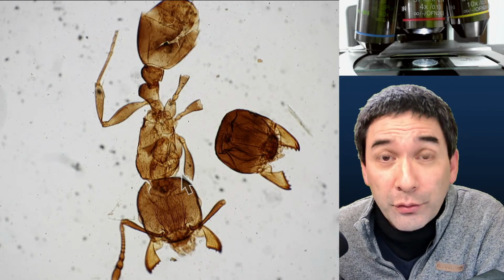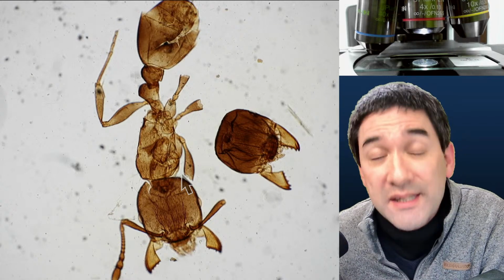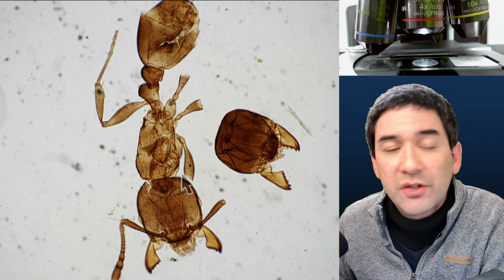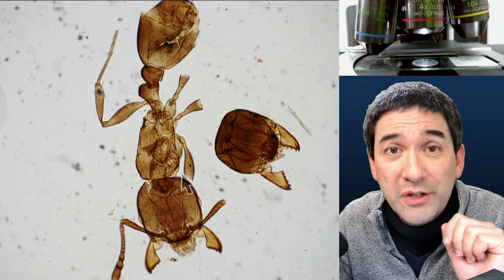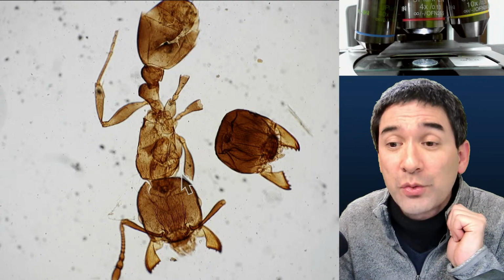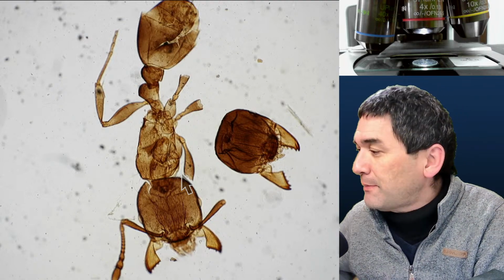Okay. Arthropods, for example, also crabs belong to the arthropods. Millipedes, centipedes belong to arthropods. They have, again, different numbers of legs. So you see, the arthropods is like a big category, right? For example, I showed you some time ago those ostracods, the water crustaceans, they are arthropods as well. So that's the thing here.